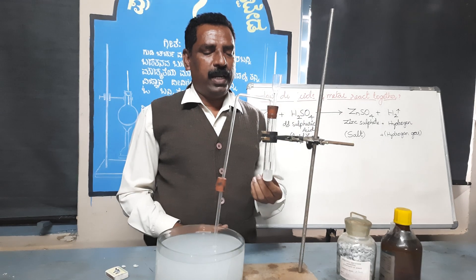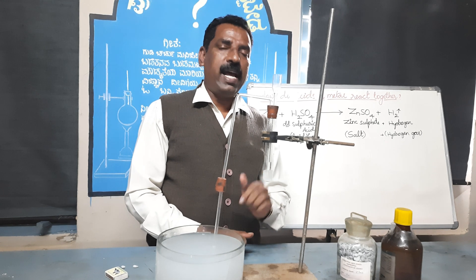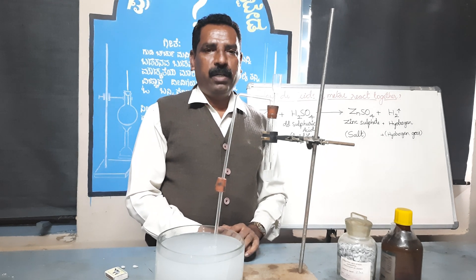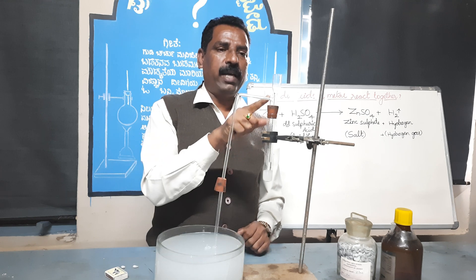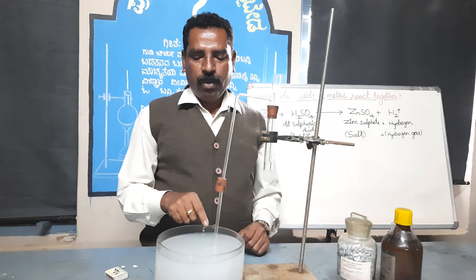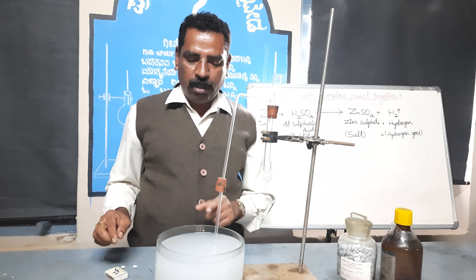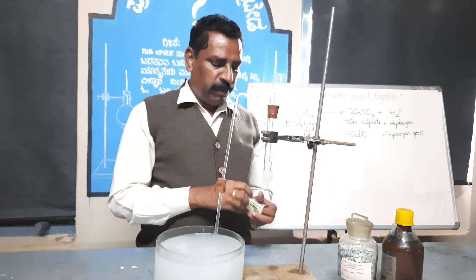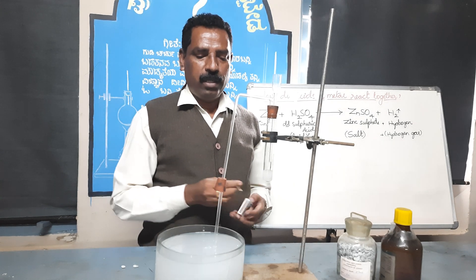Now the reaction starts: zinc reacts with dilute sulfuric acid to liberate hydrogen gas. That hydrogen gas passes through the bent capillary tube through the soap solution to form bubbles of hydrogen gas. How do we test it?